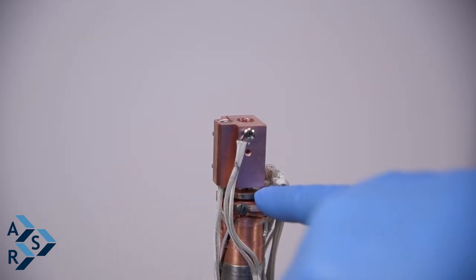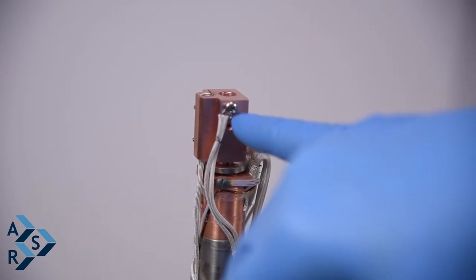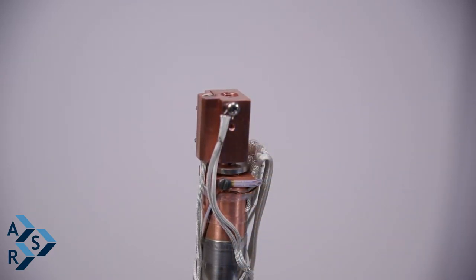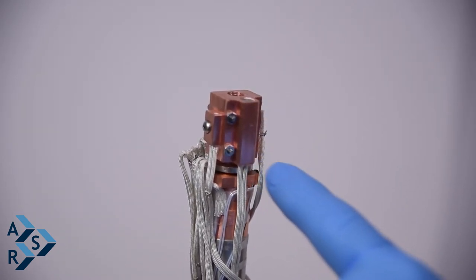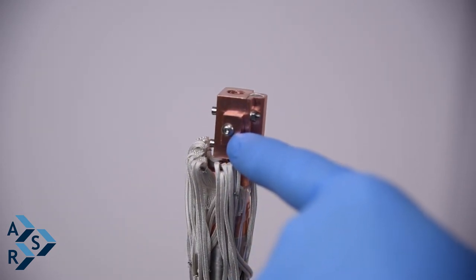But just take very good care of your sensors. This is your thermocouple. This here is your cartridge heater, 50 watt. This here is your platinum RTD.